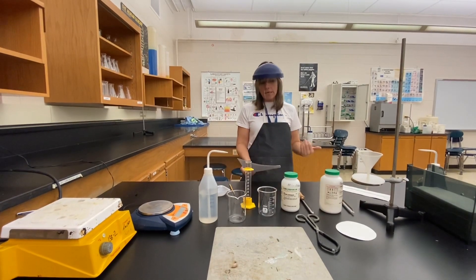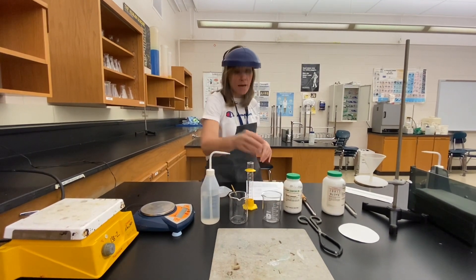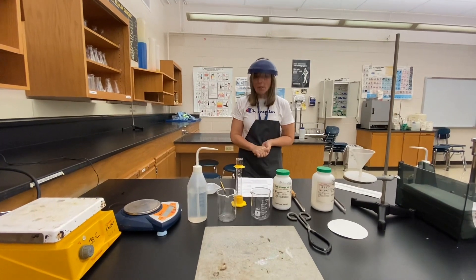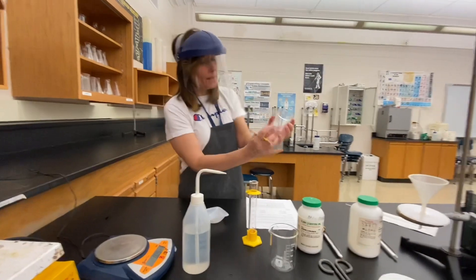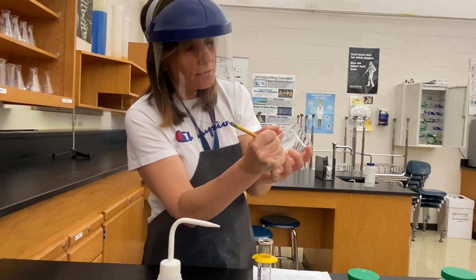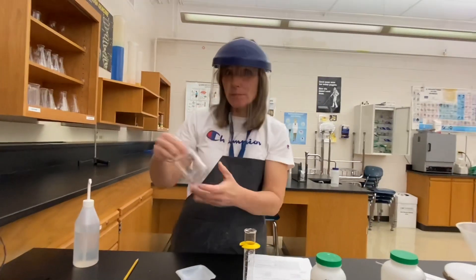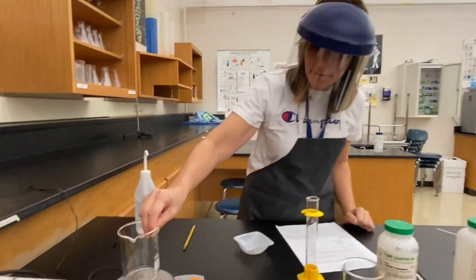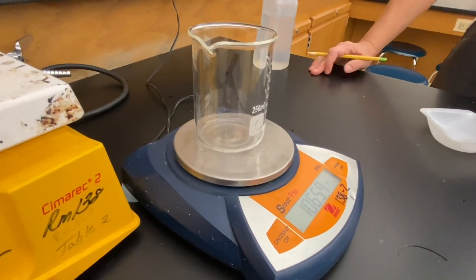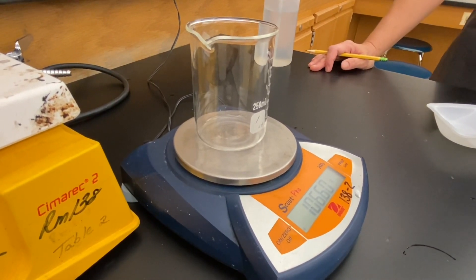Starting with day one procedure. I have my two beakers — they've been washed with tap water and soap, rinsed with distilled water, and are totally dry. I'm going to label beaker number one with a pencil and put my initials so I know it's mine, and then weigh this beaker. The mass of empty beaker one is 106.60 grams.